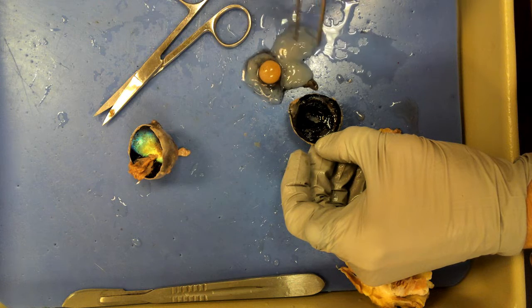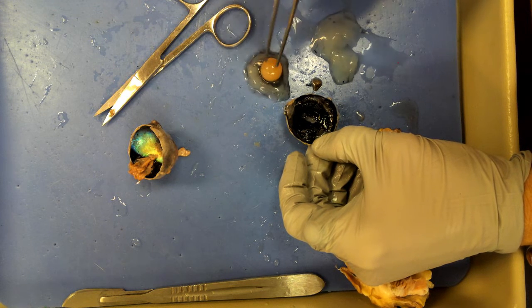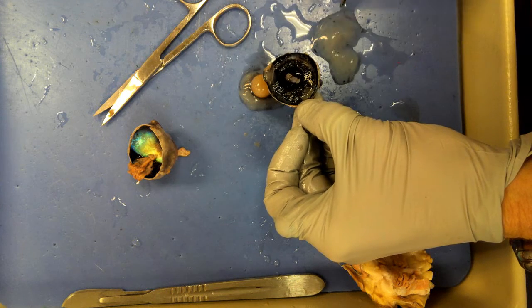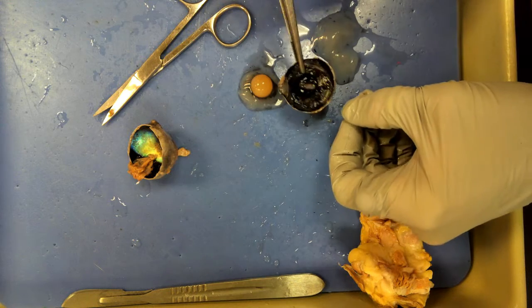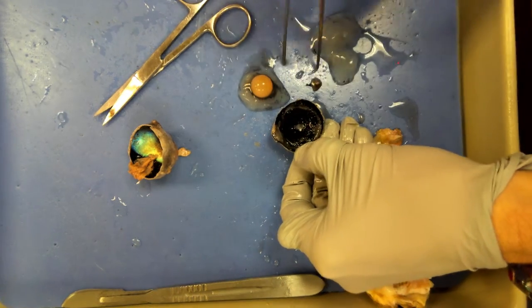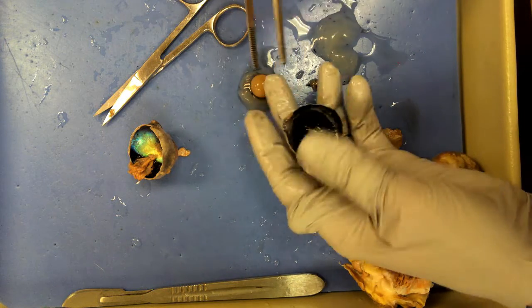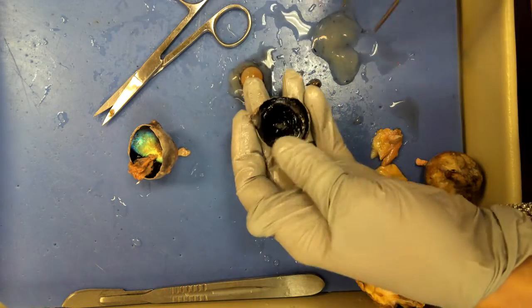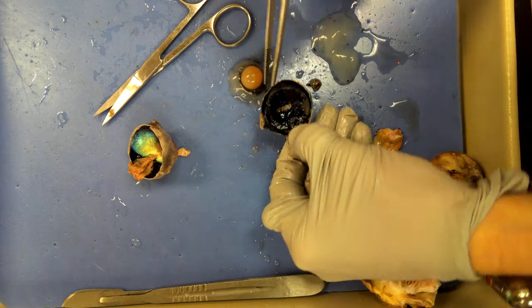The ciliary body and muscles make the aqueous humor, but the aqueous humor isn't as easy to distinguish as the vitreous humor because it's like jello. That's the lens — if you were to cut it in half it would be like a totally nasty sheep skittle. This right here is the inside of the eye. That open spot right there is the pupil, and it's not round for sheep — it's horizontal. Sheep don't need to look up into the sky for any reason; their vision is very horizontally based, and their eyes are on the sides of their head.